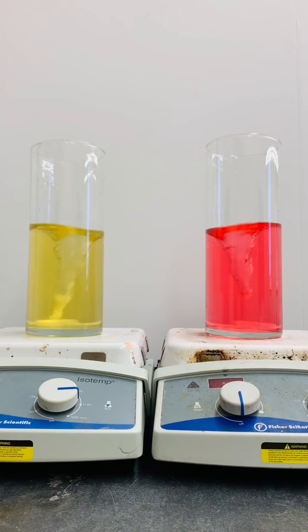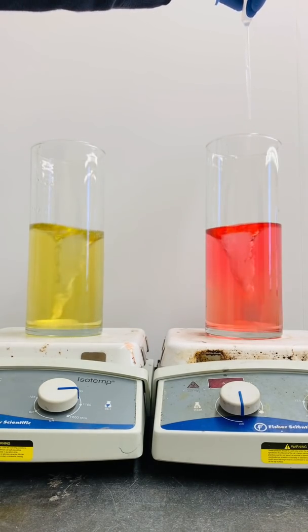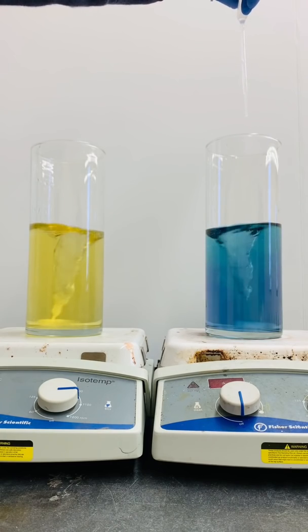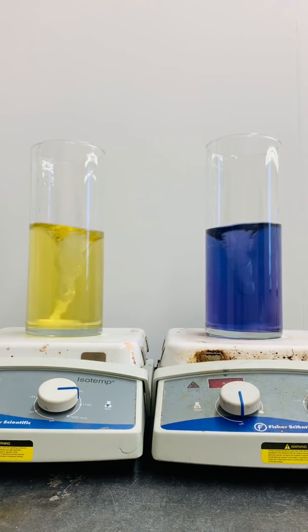Now I'm going to try adding some base to both solutions. Once again, I don't see any color change when I add it to the Alka-Seltzer solution. But hey, do you notice that? I'm seeing color changes when I add it to the solution on the right. And that blue color tells me that the solution is now strongly basic.